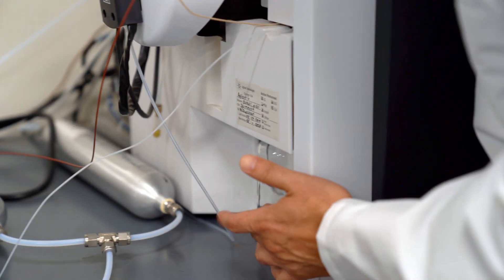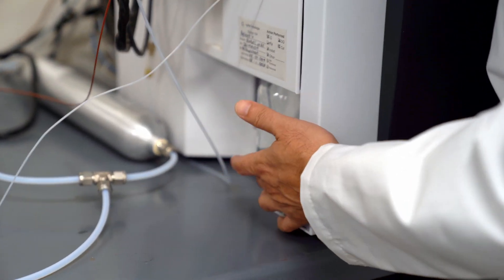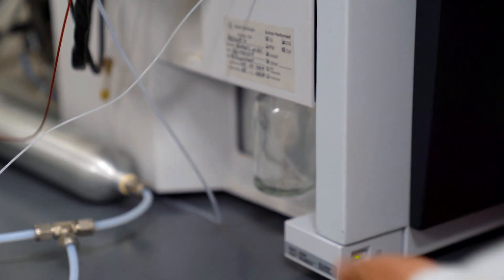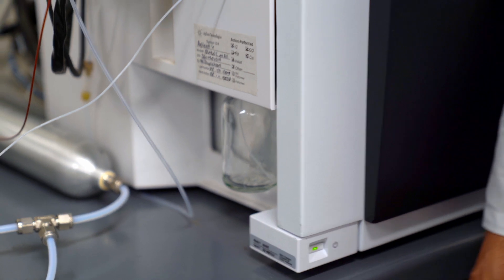The tuning solution goes right here in this bottle and you're going to need to make sure you have sufficient tuning solution in order to do your tunes. So we're going to fill that guy in and get going.